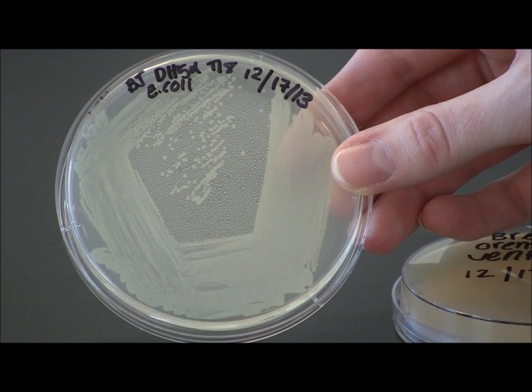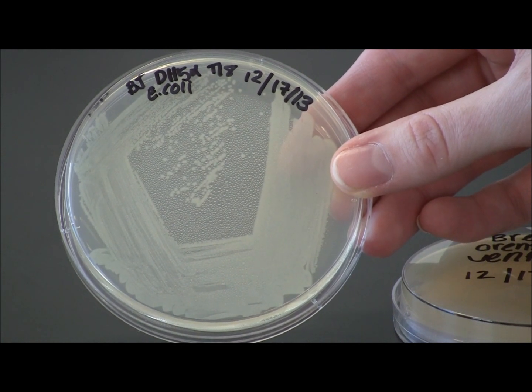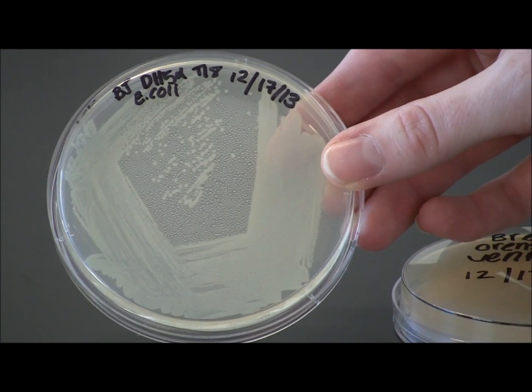This is the proper way to label a plate with your initials, what bacteria is on it, and the date that it was streaked.